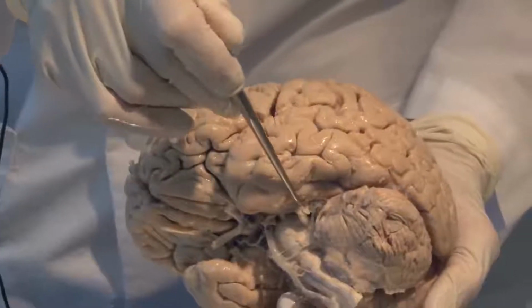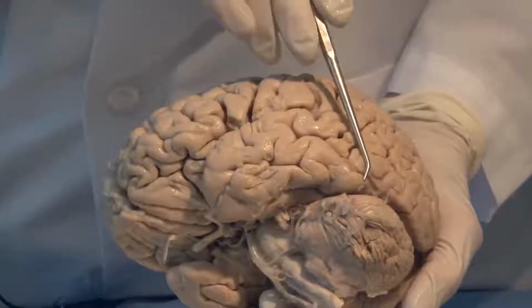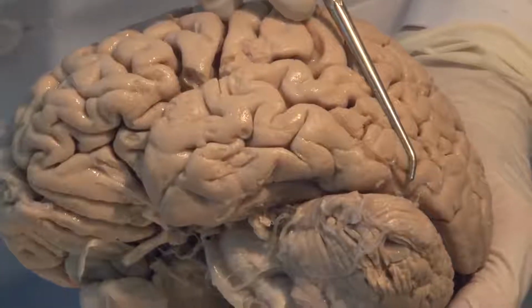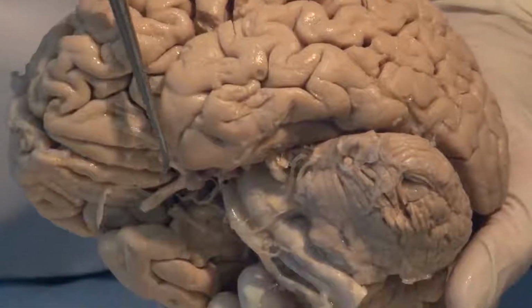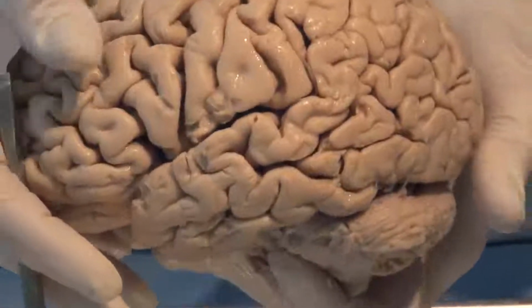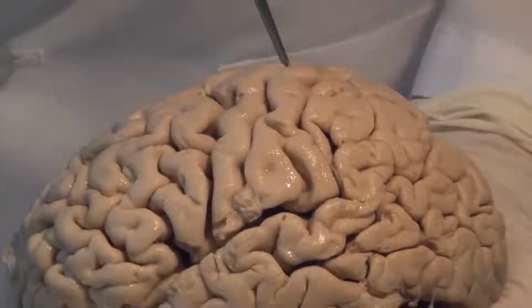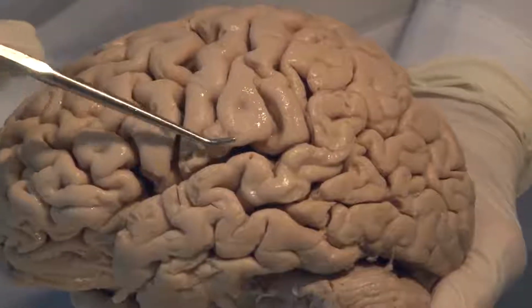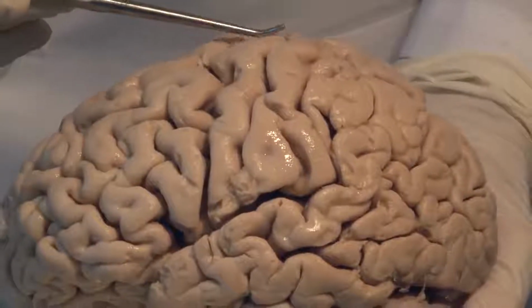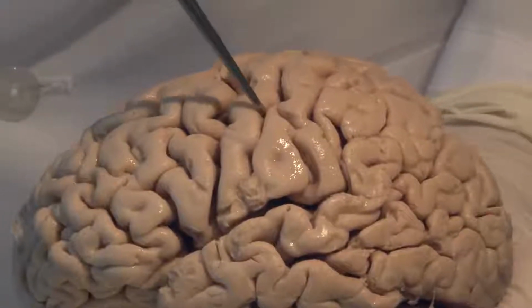You already saw the inferior surface of the temporal lobe coming back to here, and we just kind of arbitrarily draw a line and say that this is approximately the end of the temporal lobe posteriorly and the tip of the temporal lobe anteriorly. And then we look for a sulcus on the surface of the brain. Sulci are these grooves, and the surface structures that are coiled are the gyri. So we have sulci and we have gyri. The gyri have names, but we're not going to learn most of them.